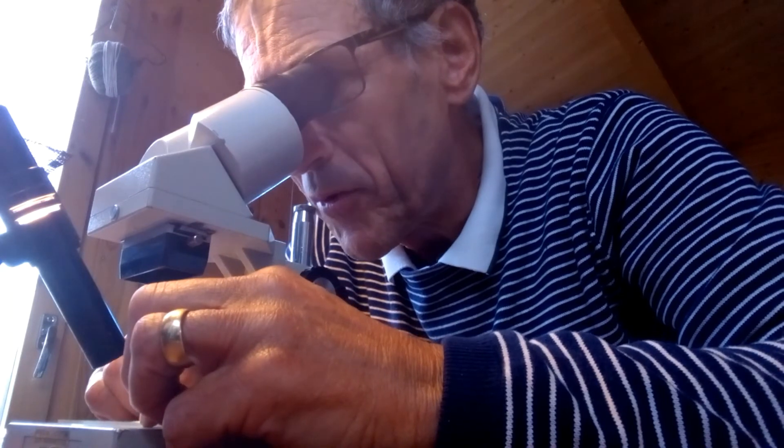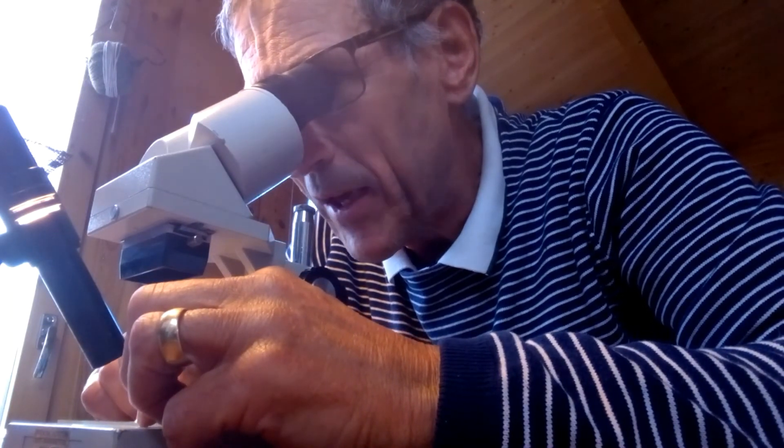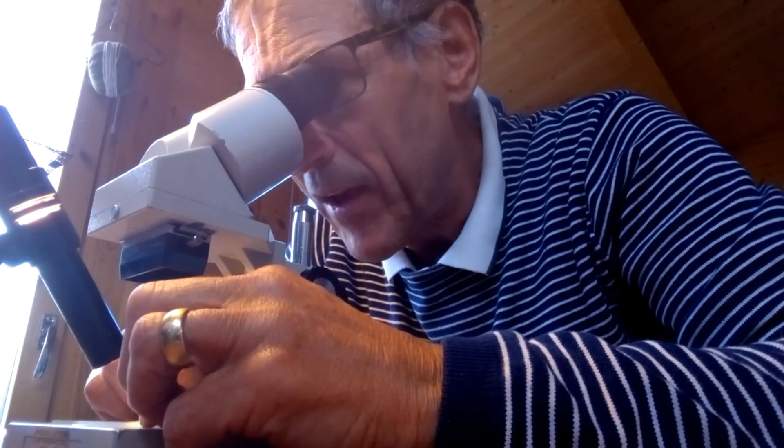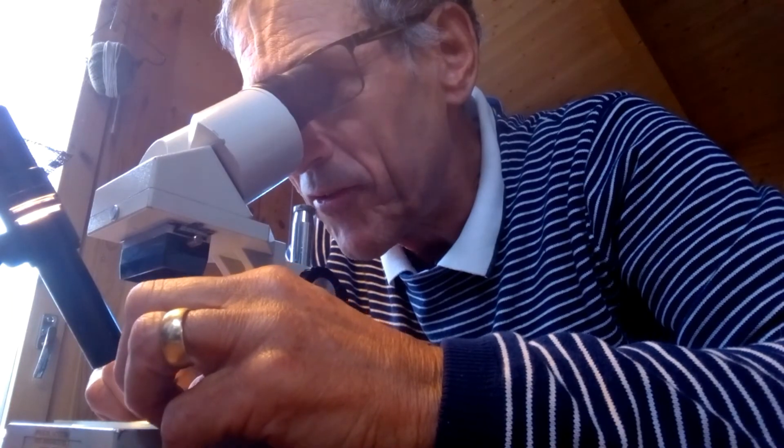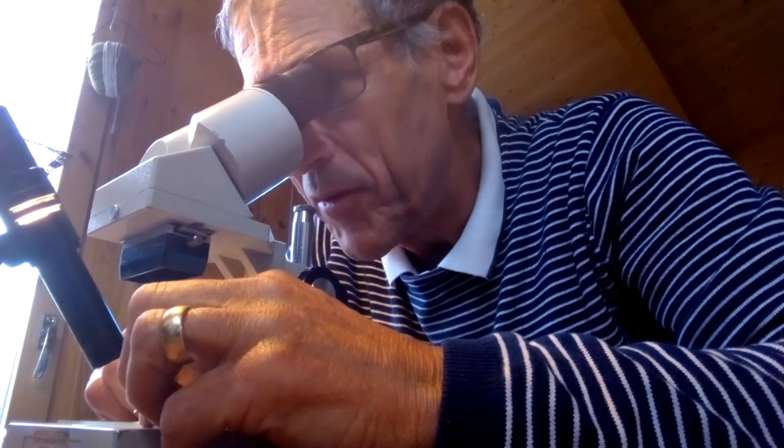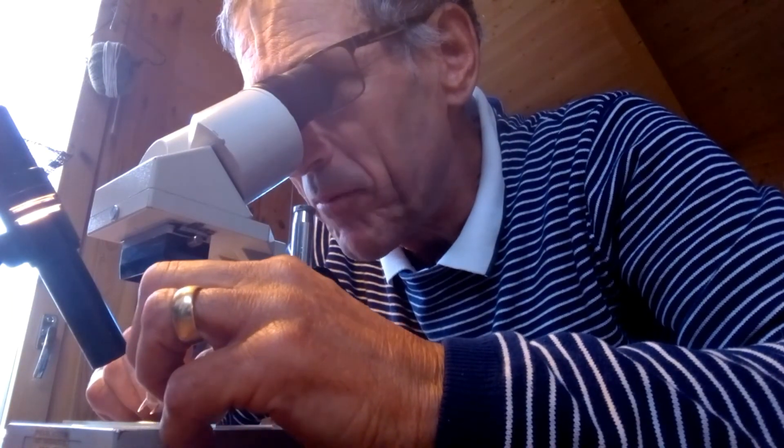So I shall pop inside in a moment and get my microscope out. I'll put a cover slip on top of here. And hopefully then I'll be able to see the cells, take a photograph of them and add them to the video.